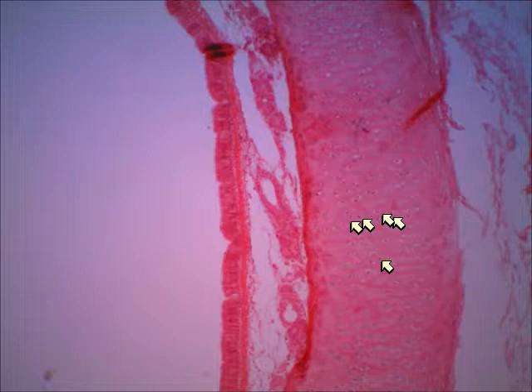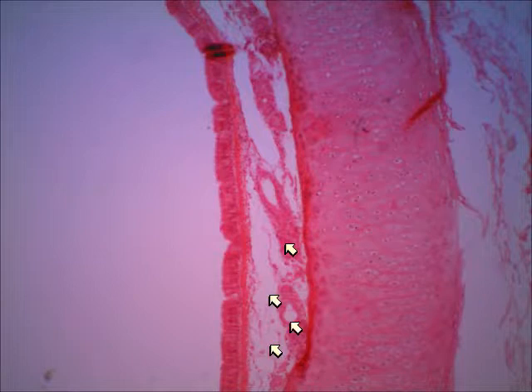The matrix of hyaline cartilage is that firm gel-like matrix, but it also has collagenous fibers in it, which don't stain very distinctly. You can just see them in general. That's the pink lines that tend to wave around the lacunae. Then if you look over on the left side, you can see the pseudostratified epithelium. Again, it's not super obvious because we're not on high power yet. In between the epithelium and the cartilage, we see an area that has some other glands. I'm pointing to a gland right there. You can see the duct for that gland, and those are some mucus secreting glands that you see just underneath the epithelial lining.